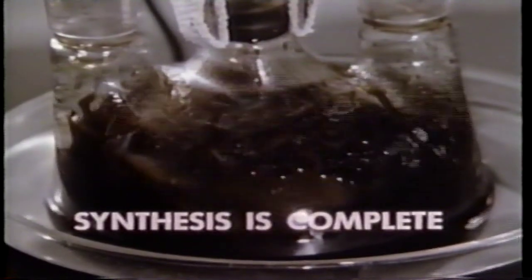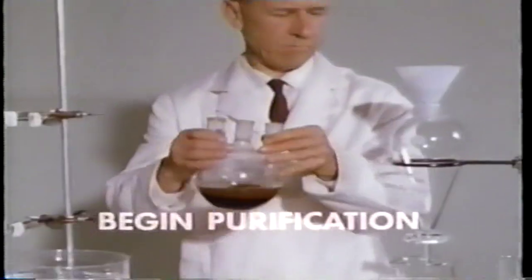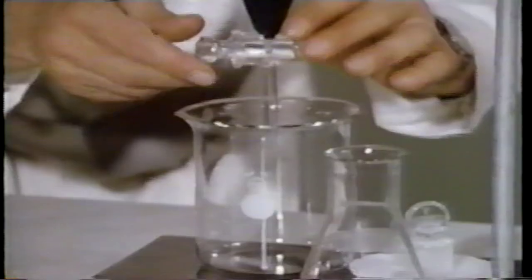How is the ketone purified from this reaction mixture? The first step in the purification of the 2-butanone is to place the reaction mixture in a separatory funnel. The ether and substances soluble in it gather in an upper layer. This is hard to see now, but will become more visible as the purification continues. The water and substances soluble in it, including most of the inorganic material and a small amount of the product ketone, settle into a lower layer.